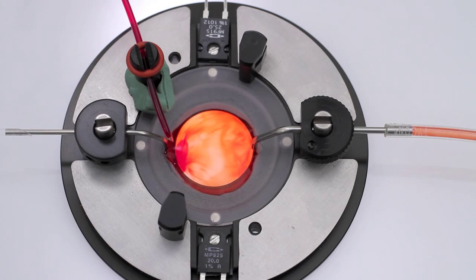Demonstrated here is the QE1, perfused at a flow rate of 2 milliliters per minute. One drop of food dye reveals the flow pattern of solution through this round bath, as well as the laminar flow that is facilitated by use of the micro-slit suction tube. The laminar wash-out pattern is exhibited here towards the end of the video clip.